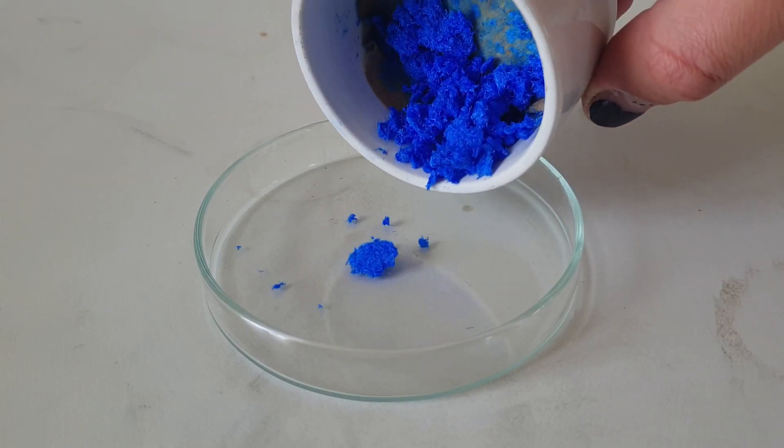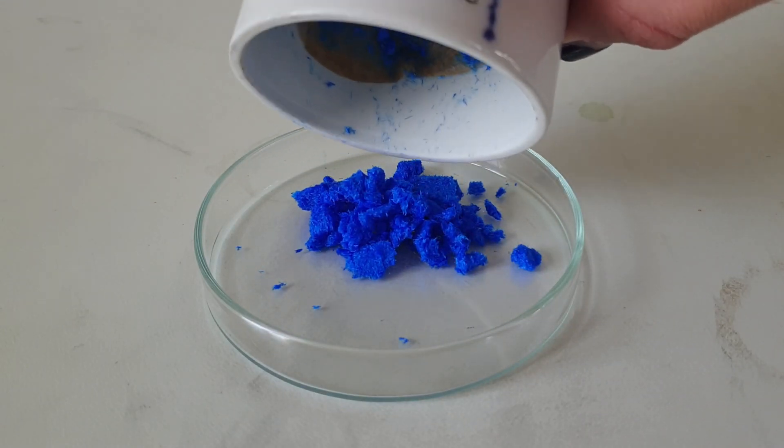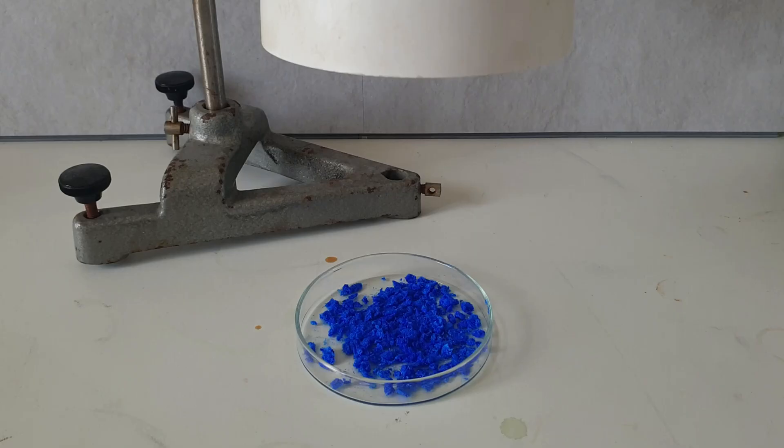The then slightly wet product was transferred to a glass dish and then dried with an infrared light.